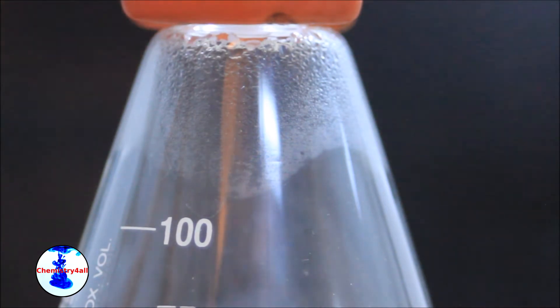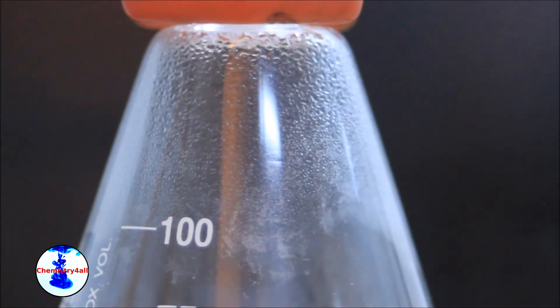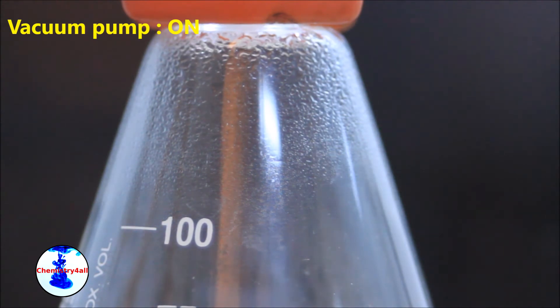After a while, you can clearly see how the molecular sieves start to release water vapor that gets rapidly condensed at the walls of the flask. In order to speed up and enhance the regeneration, we will create some vacuum cycles.